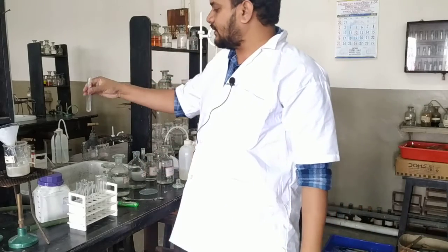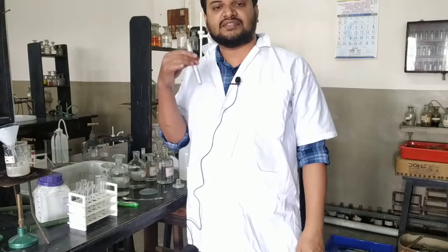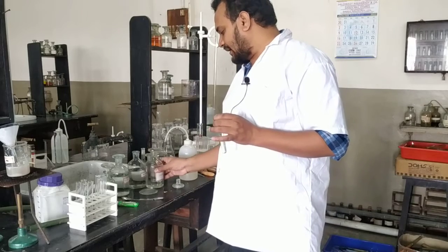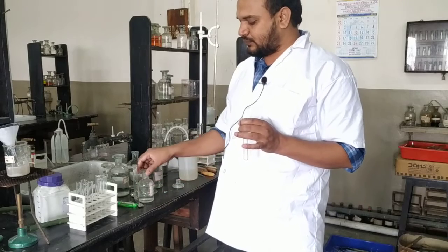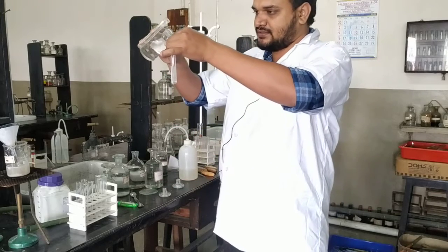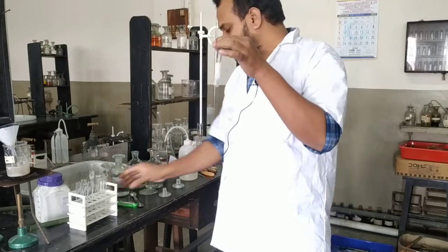Okay, so my solution is neutralized. How do you know whether your solution is neutralized or not? The dissolved carbonate will give effervescence of carbon dioxide. If the effervescence has ceased, that means the neutralization is complete. Now for the sulphate test, we add barium chloride. If we get a thick precipitate of barium sulphate, then we say that yes, sulphate is present. So here I have the barium chloride. See, a thick heavy white precipitate is obtained.